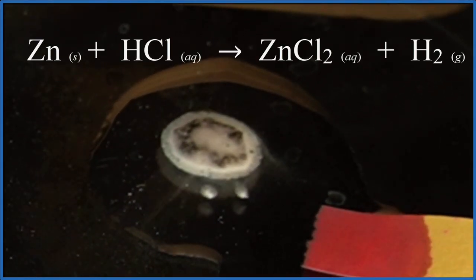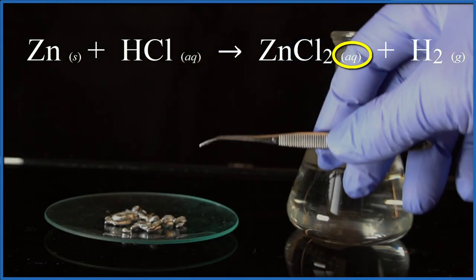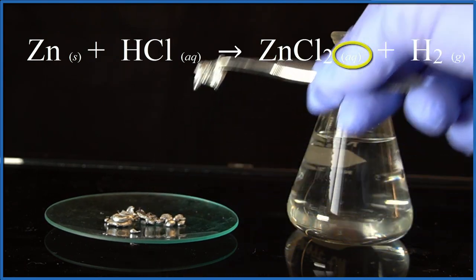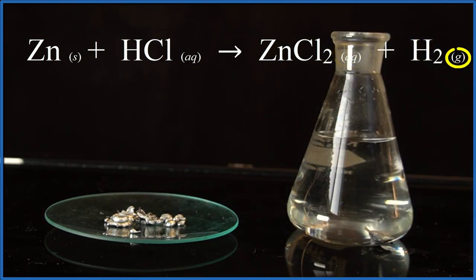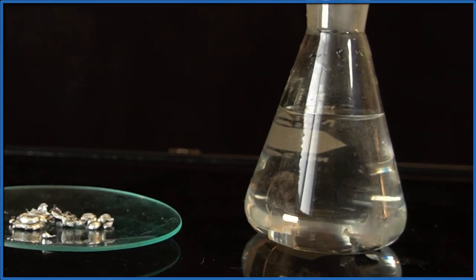The equation is zinc plus hydrochloric acid gives us zinc chloride, that's aqueous, so that stays dissolved in the water, and H2, diatomic hydrogen gas, and those are the bubbles. And you can really see them rising here in the flask with hydrochloric acid.